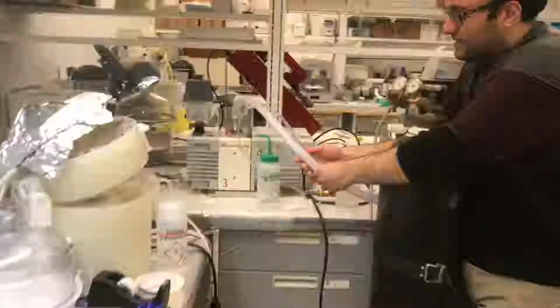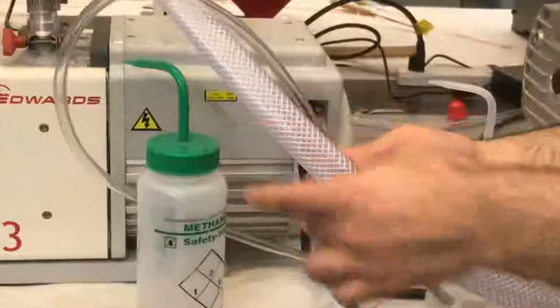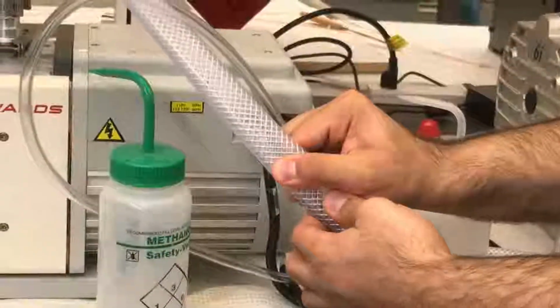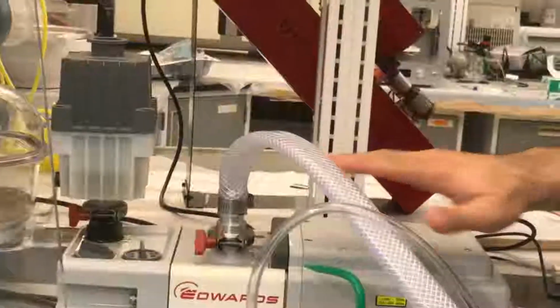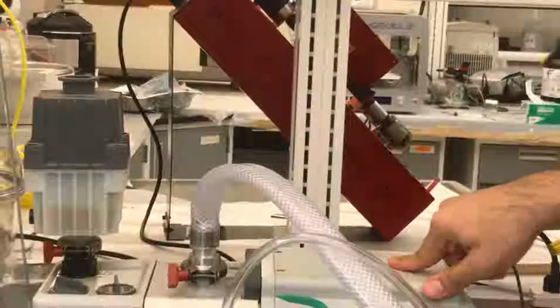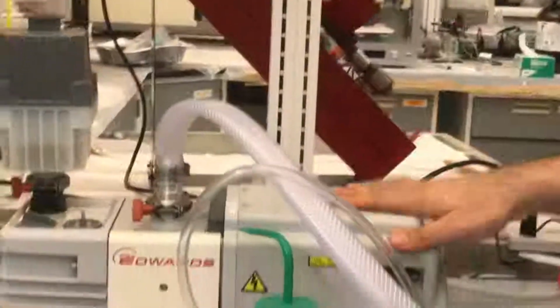Hassan, can you zoom in? This tube now it is open. You see, it is like a hole, not closed. But when the tube doesn't work, it just jams completely. The tube collapses completely. So when it collapses, no air goes inside the pump. When no air goes inside the pump, the system inside the pump jams again, and the pump then doesn't work.